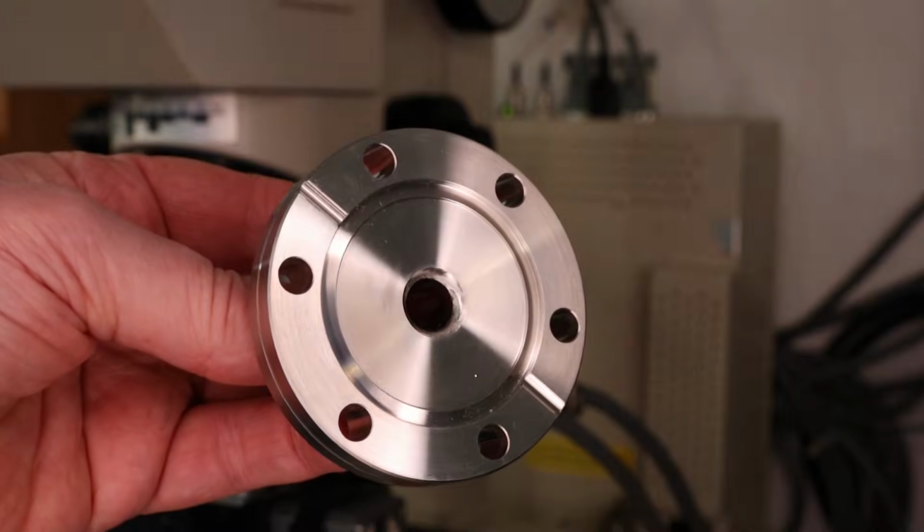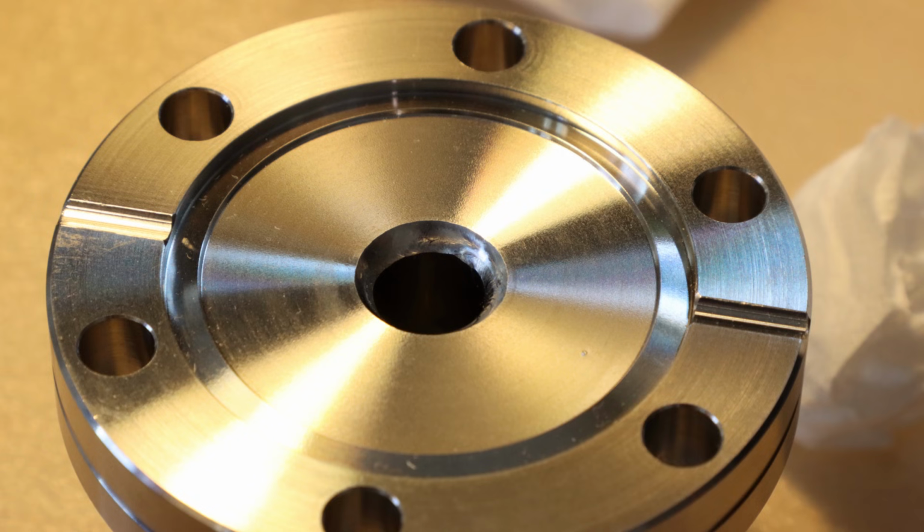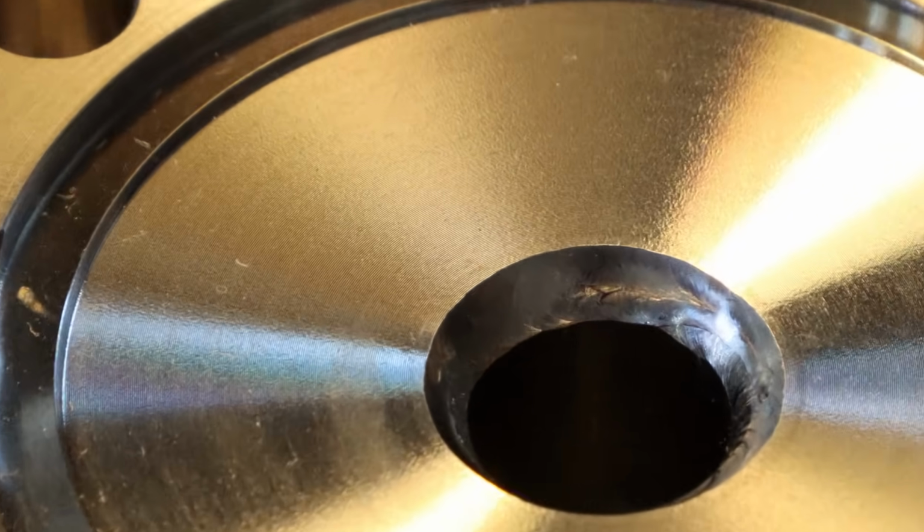The last part that I'm going to discuss is this piece of stainless steel vacuum tubing. And you can see that the manufacturing process left shallow grooves on the surface with quite a lot of microstructure. And this is confirmed when we put it under the microscope and do a scan at 20 times magnification. We observe a very regular groove pattern.